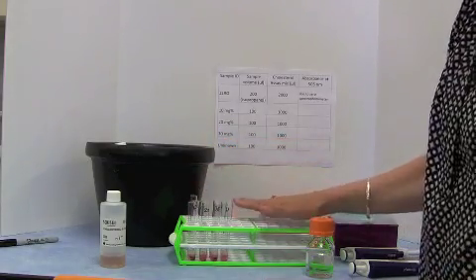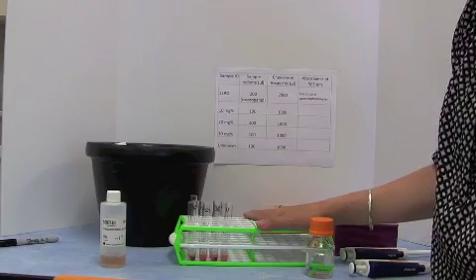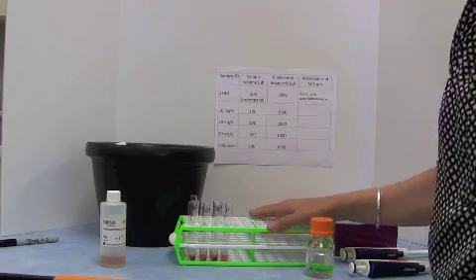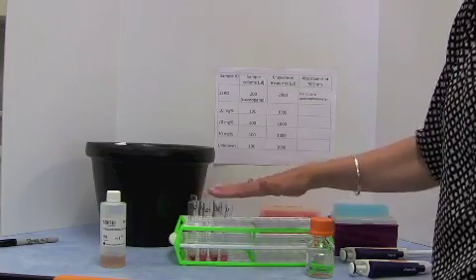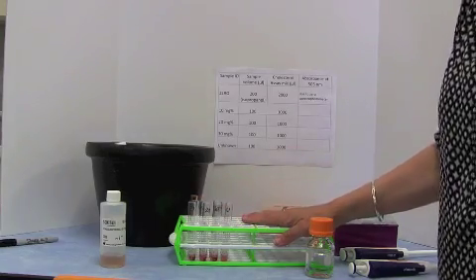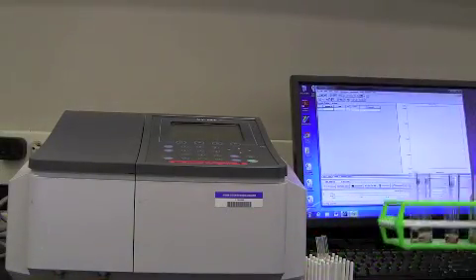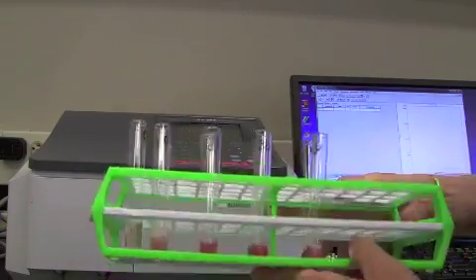So what we do now is we take these and we're going to incubate them at 37 degrees Celsius, so that's going to speed up the reaction. These are mostly human enzymes, and they work best at our temperature, which is 37 degrees Celsius. So once you've pipetted everything and mixed it, then it's going to go into the water bath for 15 minutes. After 15 minutes in the water bath, your samples will have developed some colour.